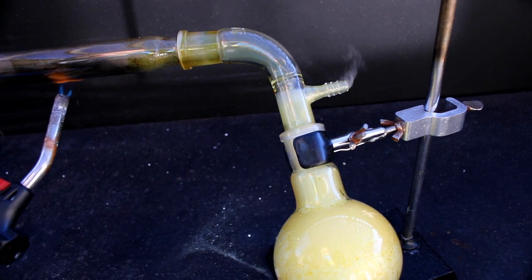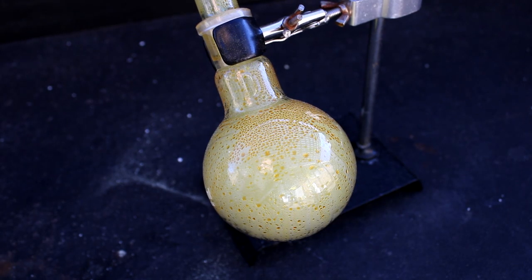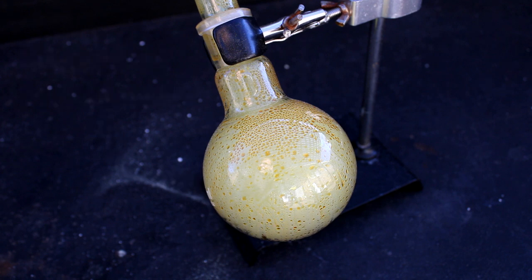As the reaction progresses, you'll inevitably be greeted with the horrendous smell of sulfur chlorides. Sulfur chlorides are truly one of the foulest things I've ever come across, and there are few things that compare to them. They smell like someone took the odor of lit matches and fireworks, allowed it to rot, and then sent it through a tire fire. Really, it's quite unique and very unpleasant.